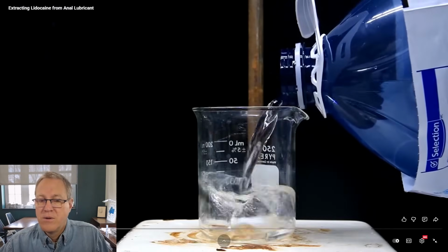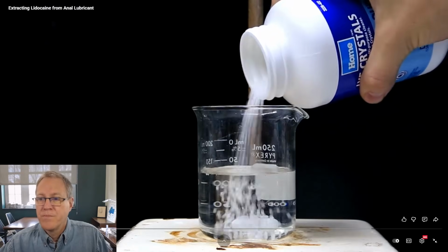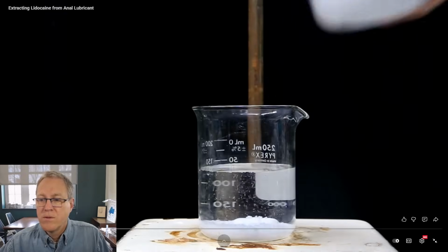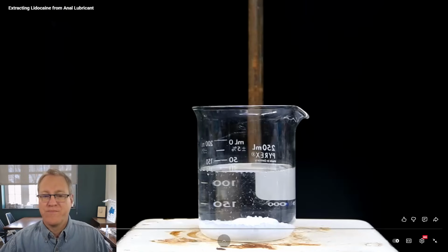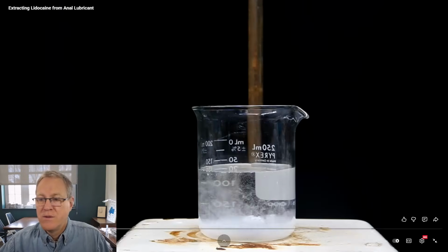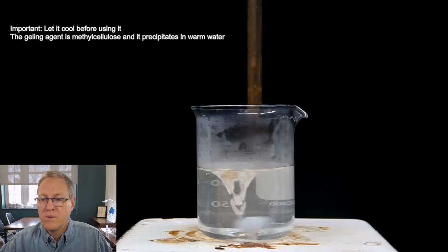To start out, we fill a beaker with a little bit of distilled water. Then we add pretty much an arbitrary amount of sodium hydroxide to it. It's not arbitrary. He's got a feel for how much he wants. It's not totally arbitrary, but let's call this a 10% sodium hydroxide solution in water. Then, using the magnetic stirrer, we stir until we get a nice clear solution. Dissolving sodium hydroxide releases quite a bit of heat, so by the end the solution might be steaming a little.